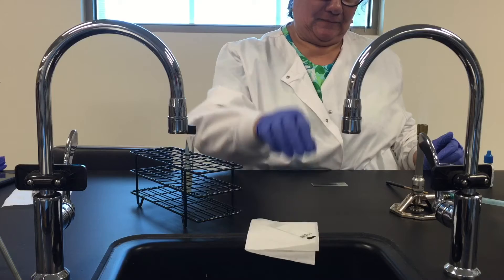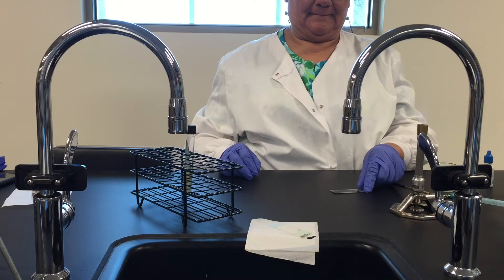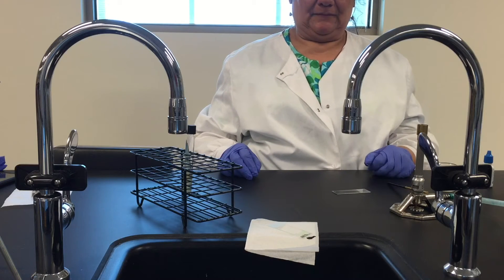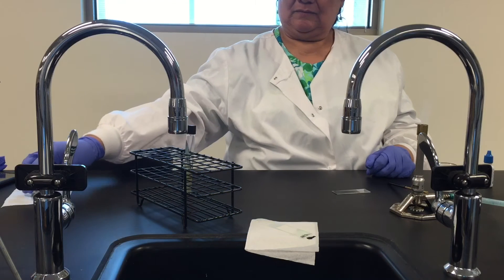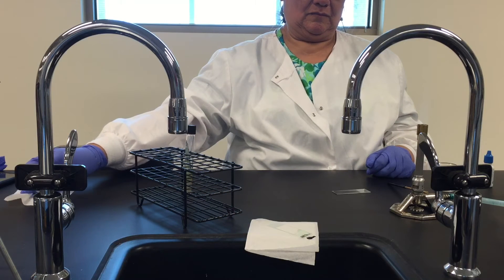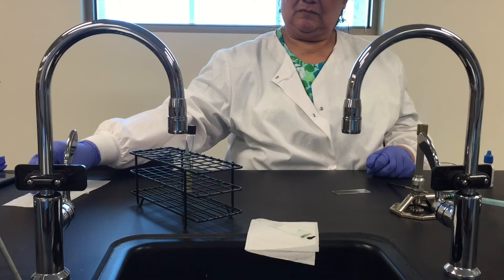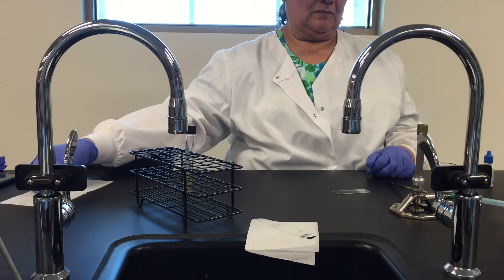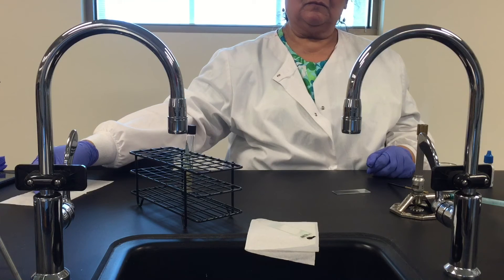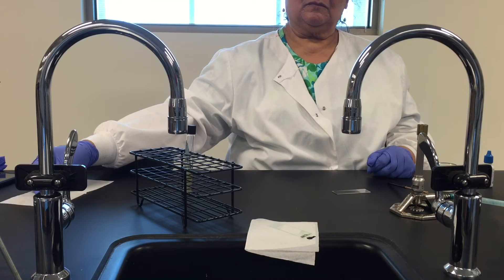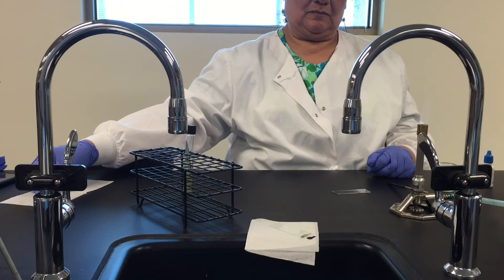Now we're going to let this slide air dry thoroughly. We will not heat fix and we won't put the slide on the slide drying rack either because it's just going to get too warm. If we do that or if we heat fix the slide, even if there are capsules present they're going to just shrivel up from the heat. So we're going to let that negative stain air dry completely.